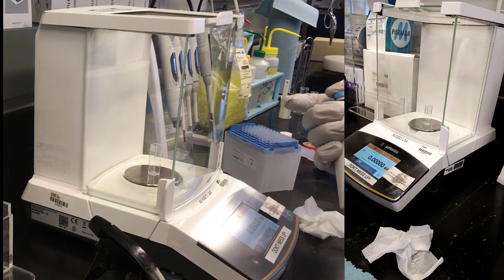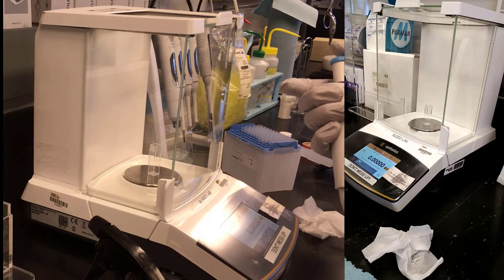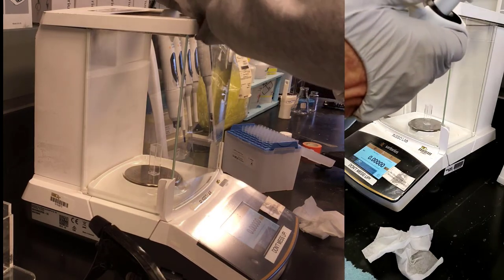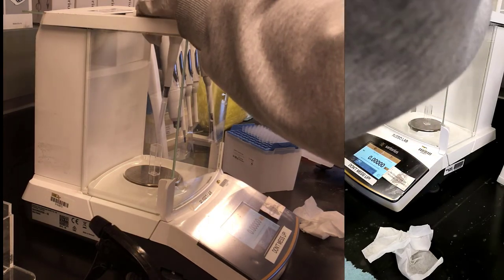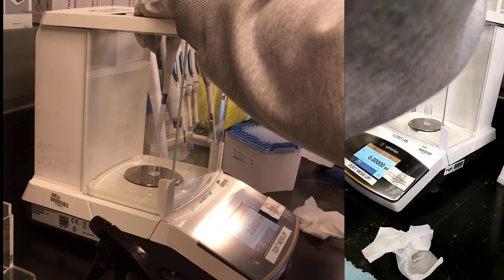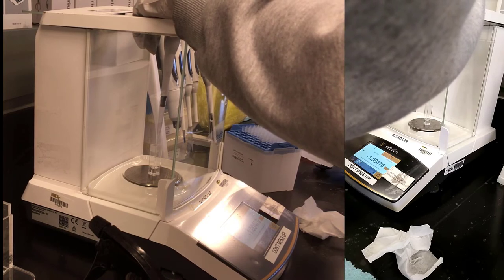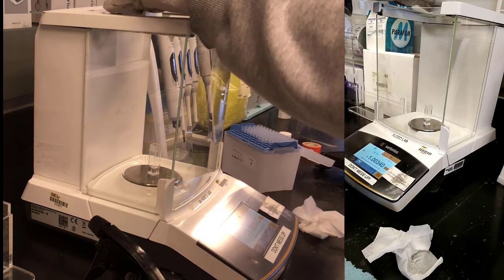So you insert the tip there. Gently bring it up. I don't normally use this top loading feature, but I will today. I will steady with two hands and be sure I don't squirt something noxious on the balance pan itself. And we'll push everything in. When you get to that first push point, you wait a count of two or three or four or five, and then push out. You sometimes get one last little drop that way.